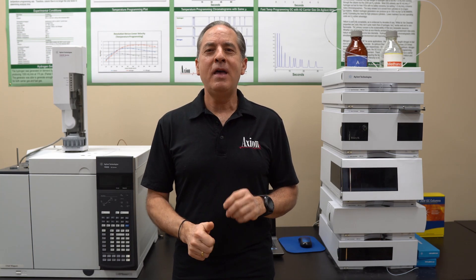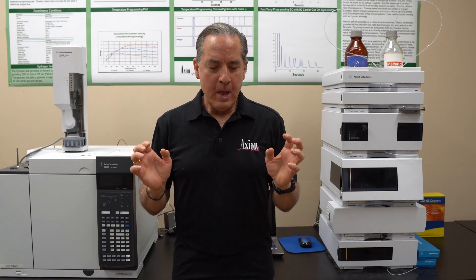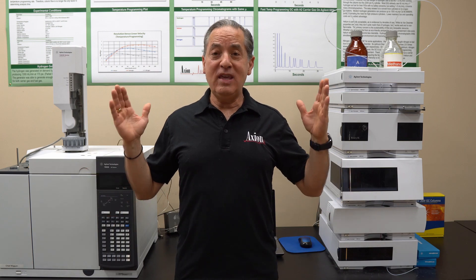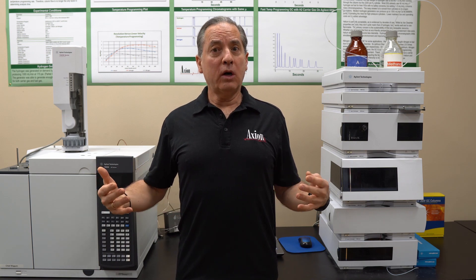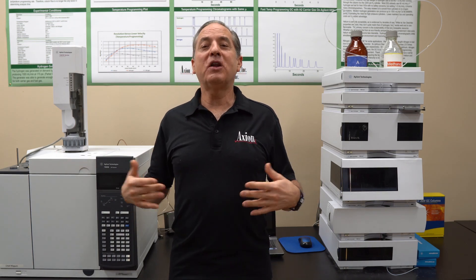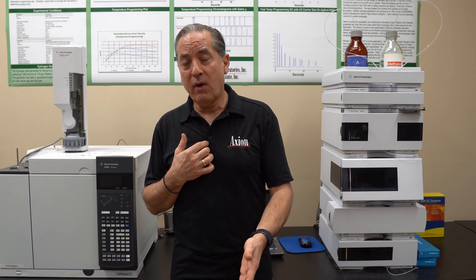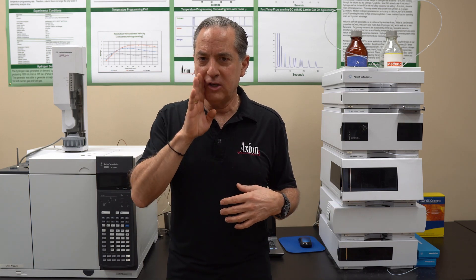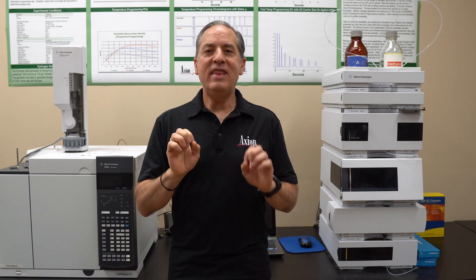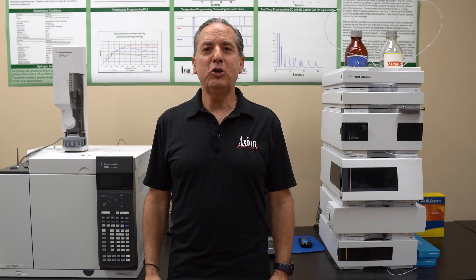Start with a column that gives you the most efficiency — efficiency is a measure of peak narrowness. In method development you don't yet know how much efficiency you need, so start with the longest, highest-efficiency column. If it works and you have empty space in the chromatogram, you can go to a shorter column to save time. Start with a 10 cm 1.8-micron, or 15 cm 3.5-micron, or 25 cm 5-micron column — those are your brute-force columns. A good base-deactivated C18 at high efficiency will handle most reverse phase applications. That's your go-to for choosing the right HPLC column.